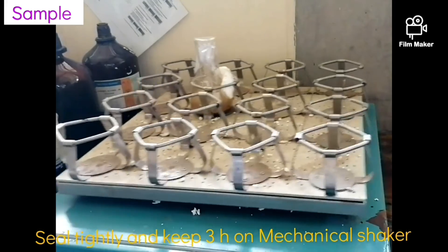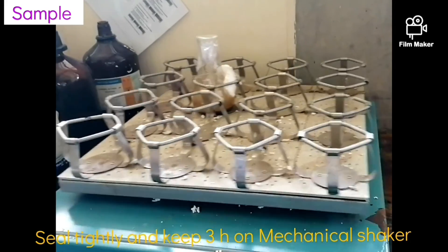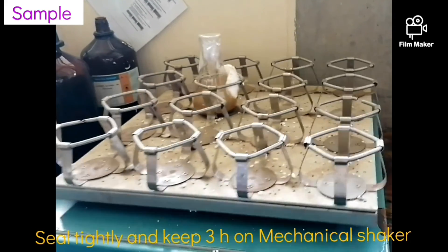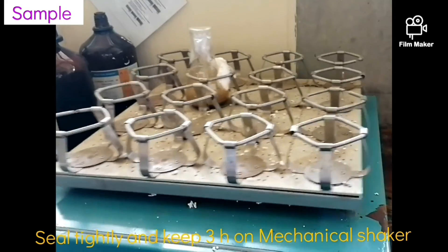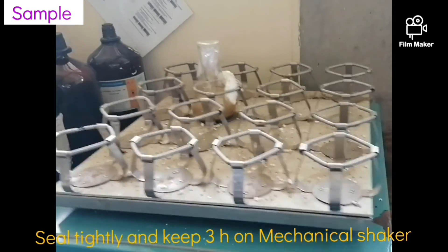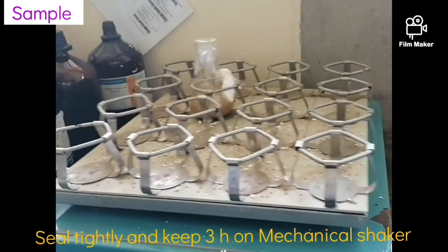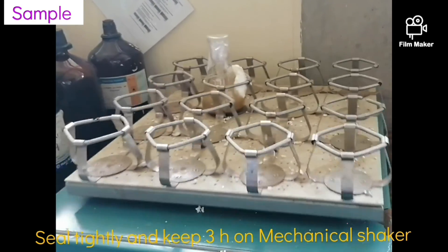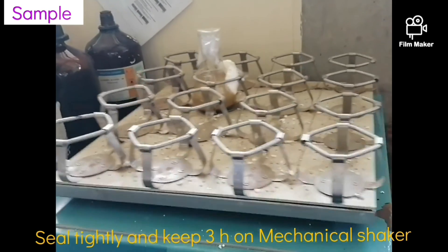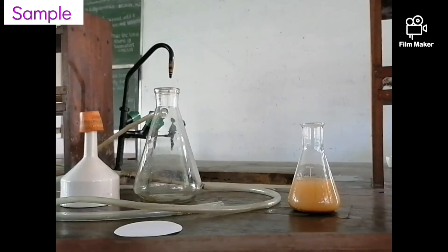Next, seal the opening of the conical flask tightly. Then place the sealed conical flask on a mechanical shaker for 3 hours to mix and react the soil with the calcium hydroxide solution.